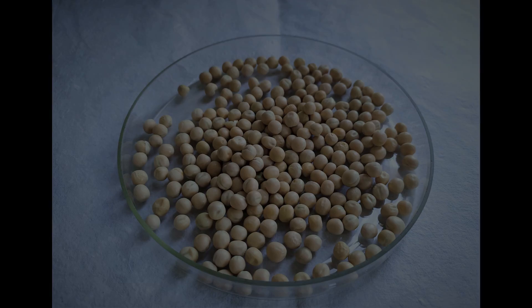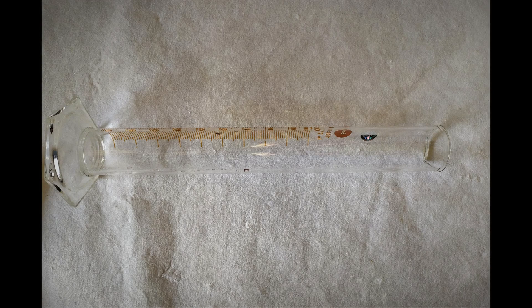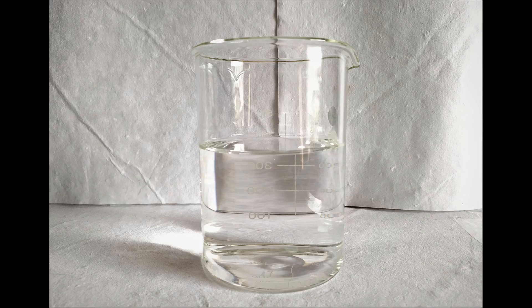For this experiment, we'll need the following: a graduated cylinder, dry seeds, and water.